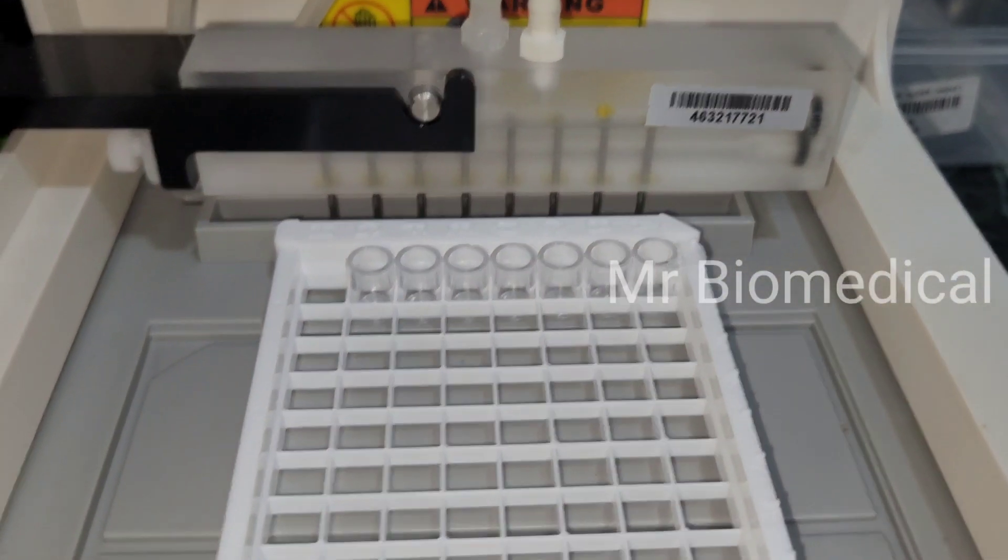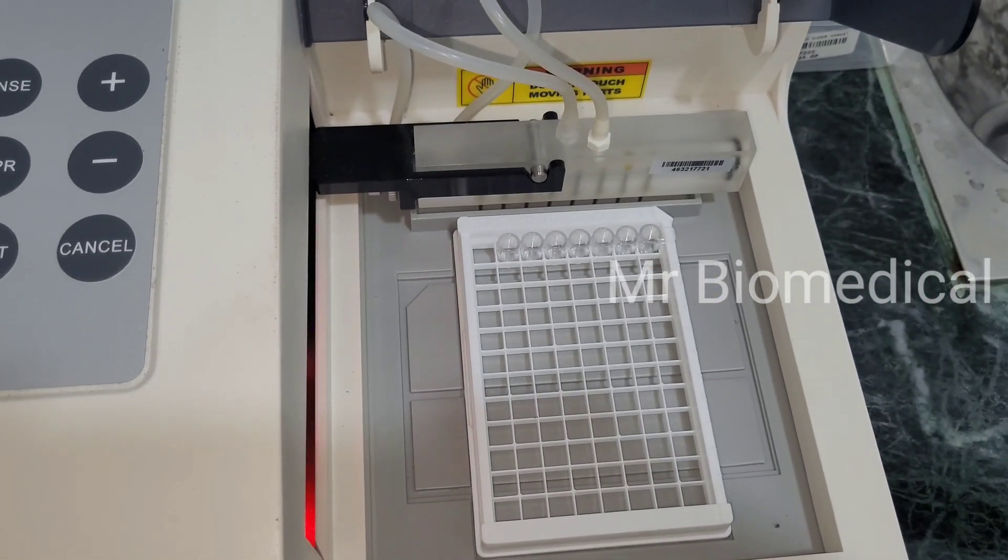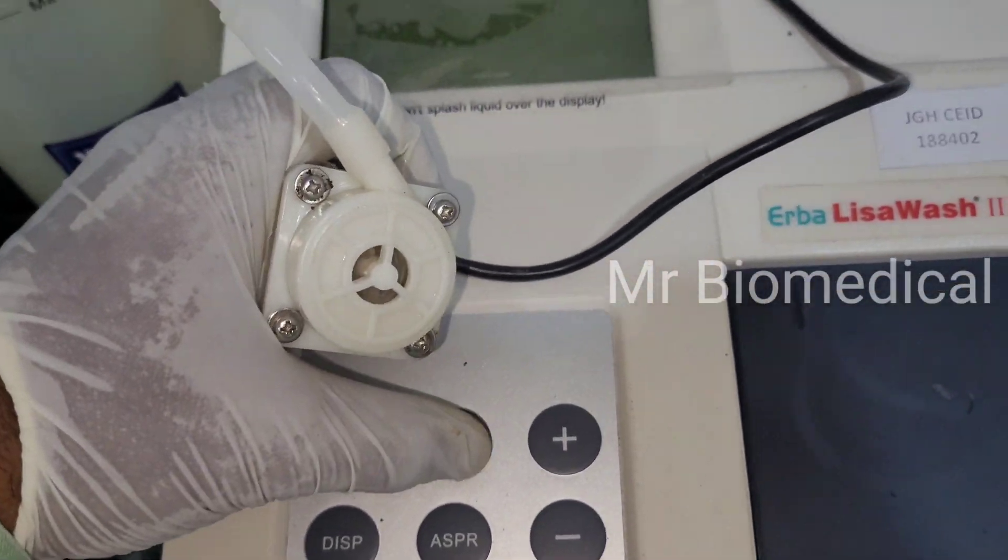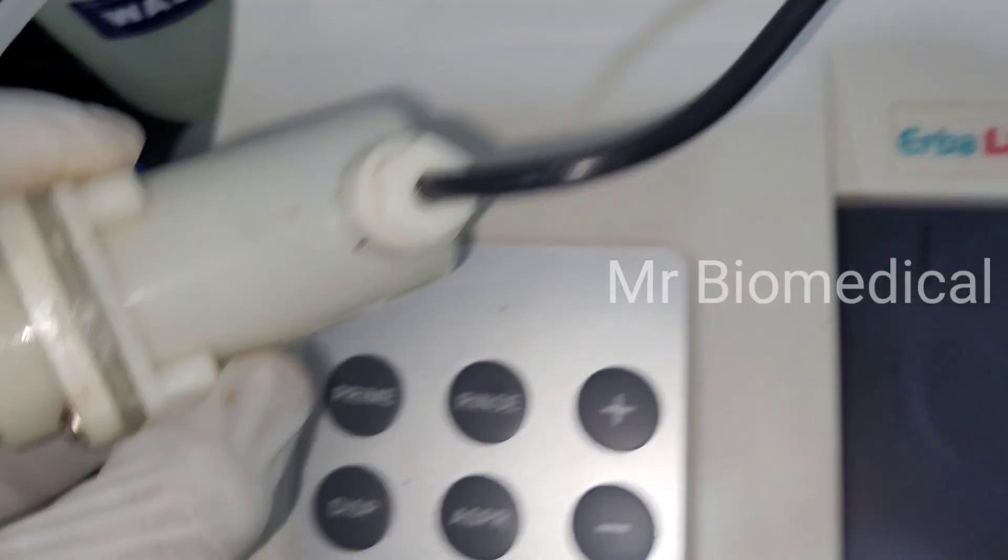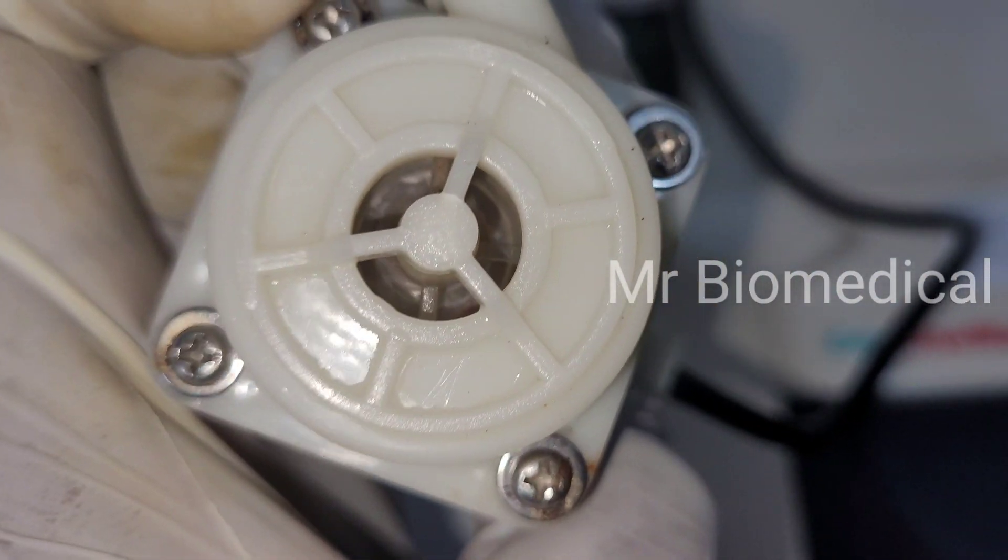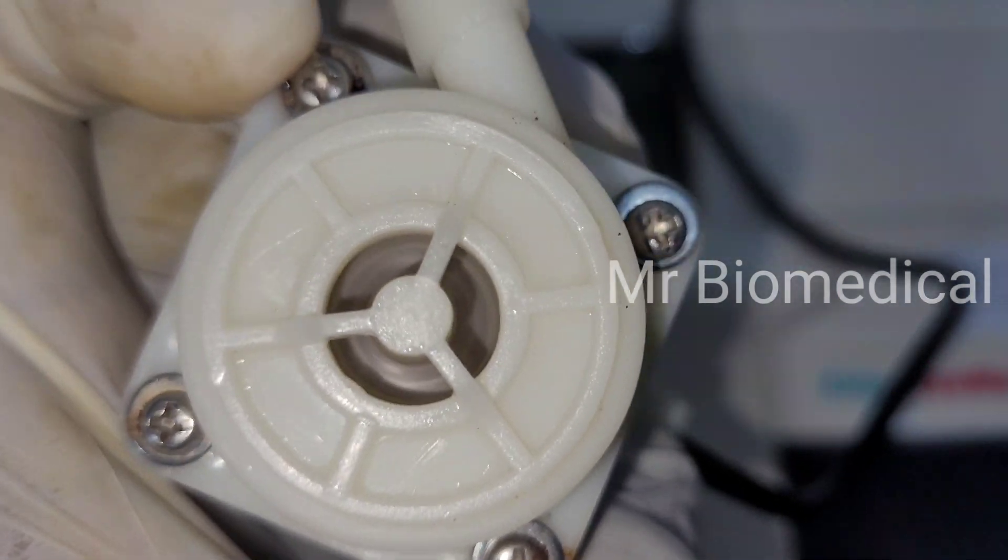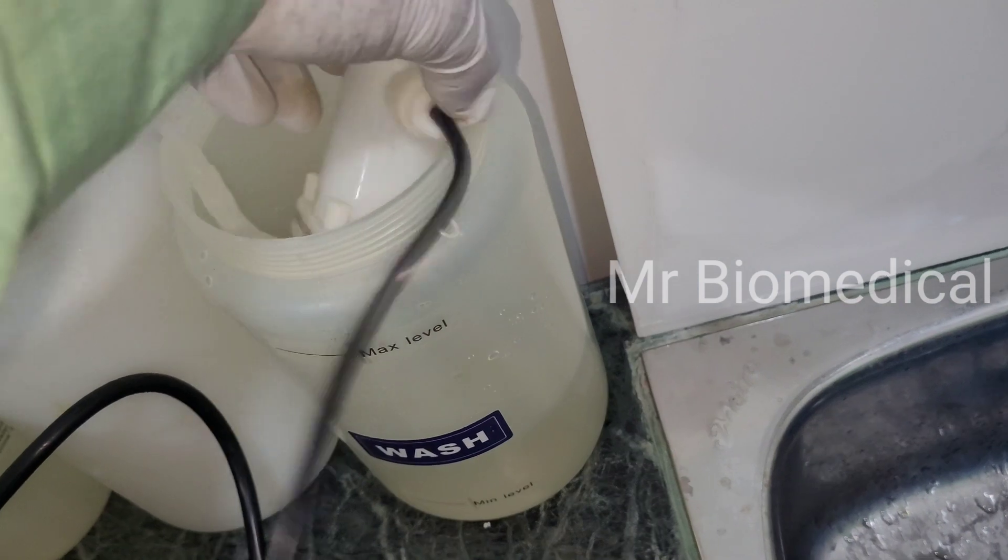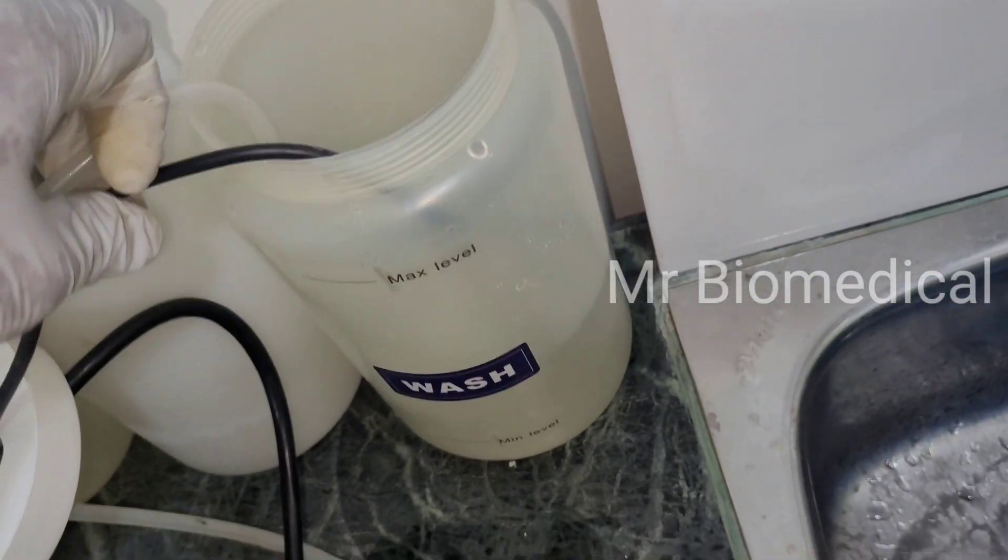Let's see if the motor is working good or not. Now we will check if the motor is working good or not so I am going to switch it on. Now you can see the motor is spinning, that means it will pull the water out.